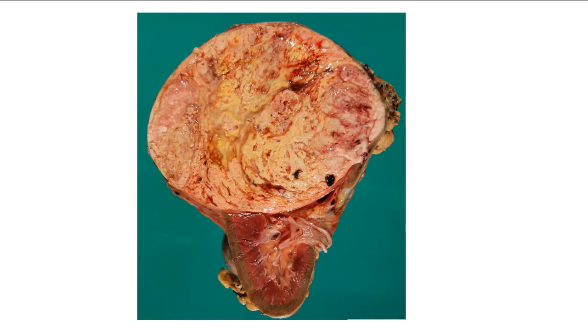And how much formalin are we going to put in the container? So in relation to the volume of the specimen, am I going to put an equal volume of formalin or? Okay, a little bit more than 3 times. 10 times is a minimum, yes. So at least 10 times the volume of the specimen, fabulous, of formalin must be included in the container.